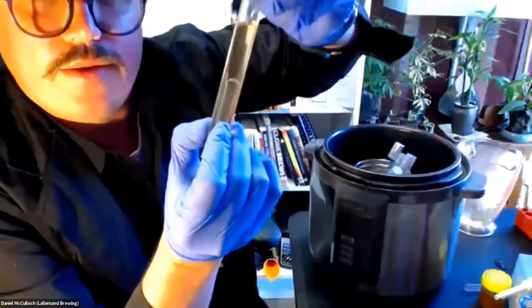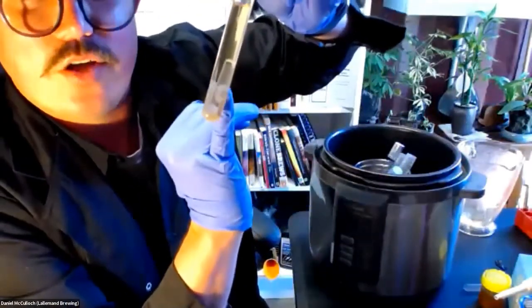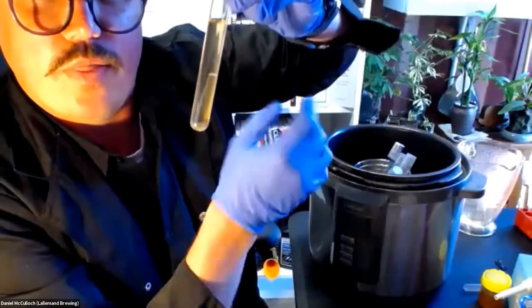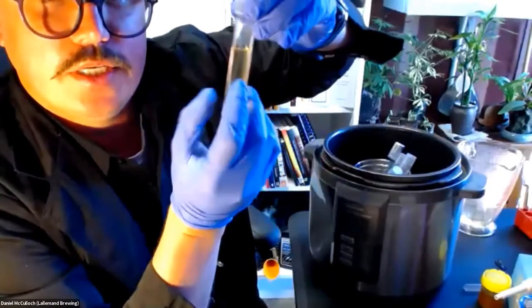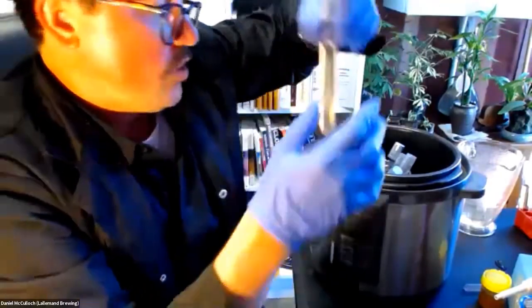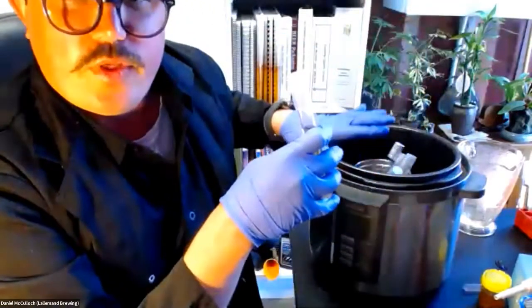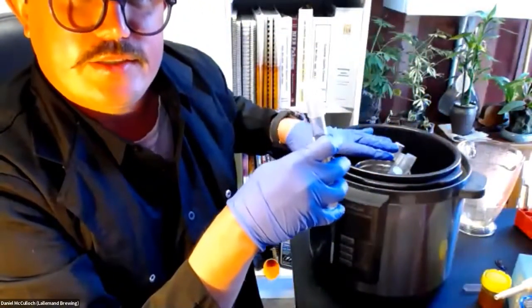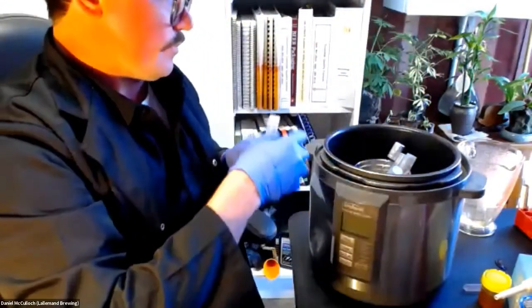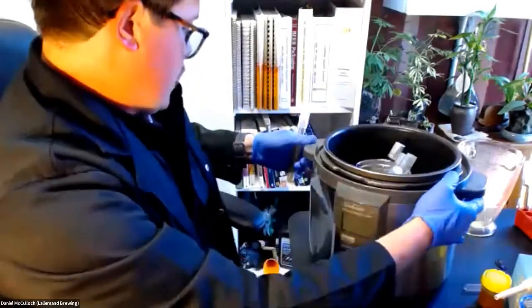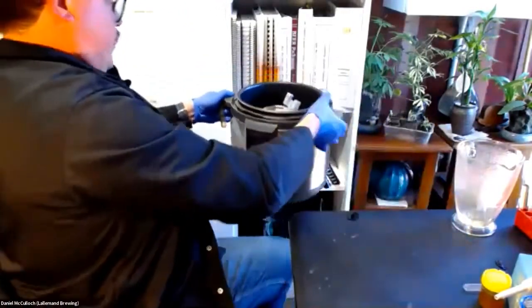And you can see here, as one I prepared, that tube's set down, and there's no bubbles in there. And that's what we want, and that's been autoclaved. So, as you put all these tubes in your pressure cooker, put that on for steam setting for 21 minutes. As they come out, you want to let those cool down, and then once they're cooled down, you're able to inoculate.